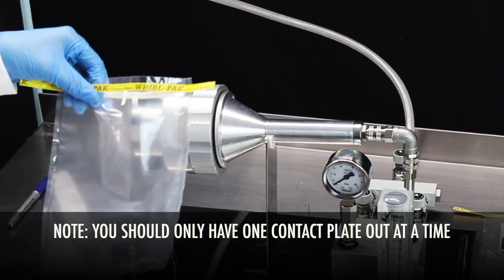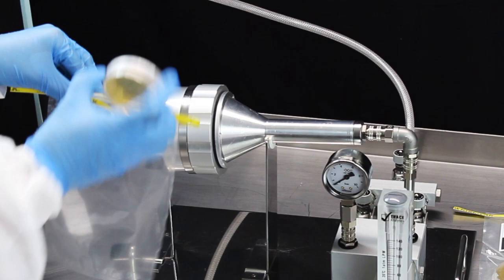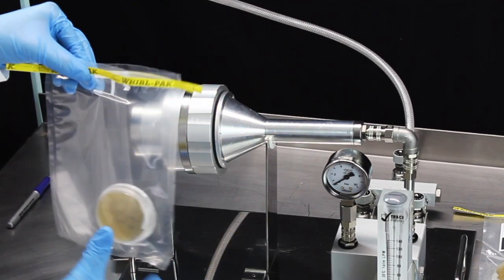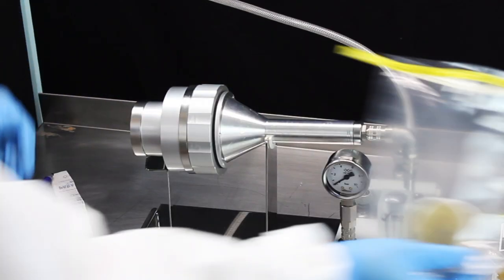Place the sealed and labeled contact plate into the provided sterile bag. Up to 8 sealed plates can fit in a single sterile bag provided.